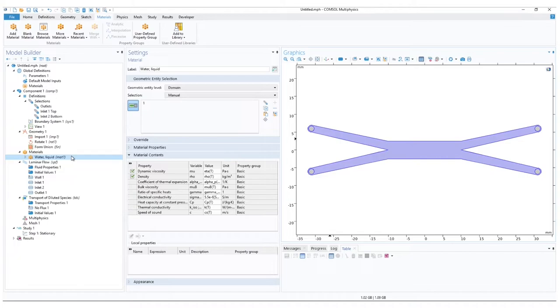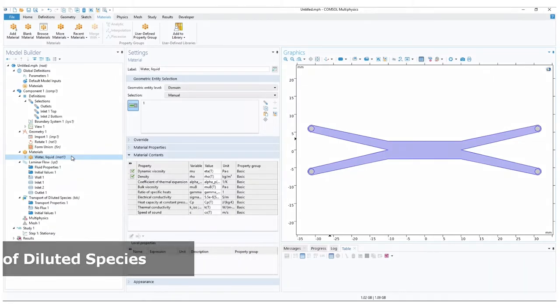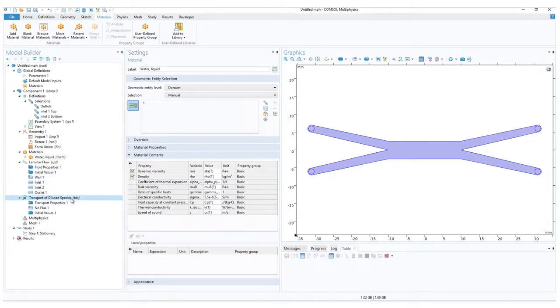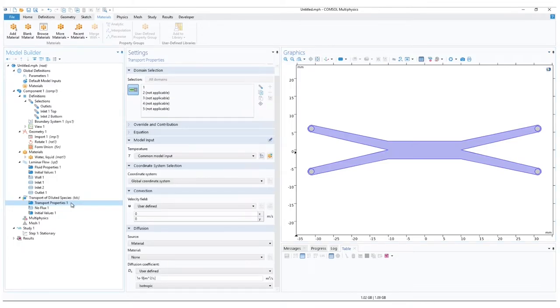Next, let us move to the physics of transport of diluted species. Select the physics and verify the domains. Again, clear the selection and select only the areas needed. Before we move to adding inlets and outlets, under the diluted species physics, open the transport properties. Since our expected mixing process is based on diffusion, we need to specify the diffusion settings.